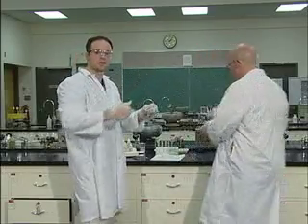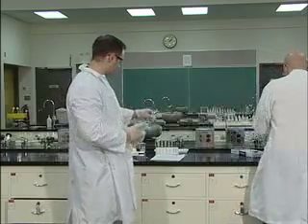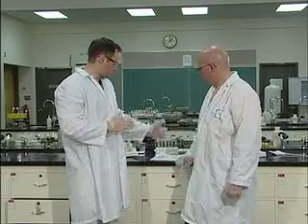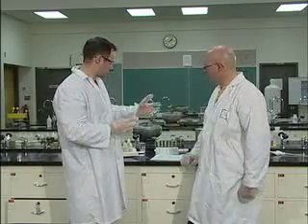Normally where there's a temperature change, there's a reaction, or in fact all the time when there's a temperature change in this reaction. So again, you're going to do basically those same steps for C1, C2, C3, C4, all the way through, noting observations and temperature changes for each one. That was just an example. I just chose the aluminum because it had the, I got to say flocculant again.